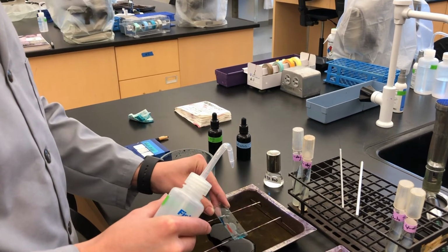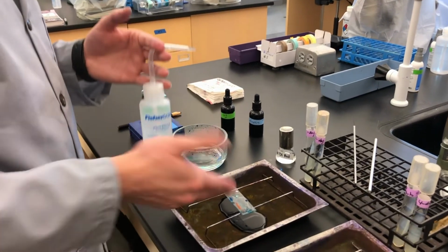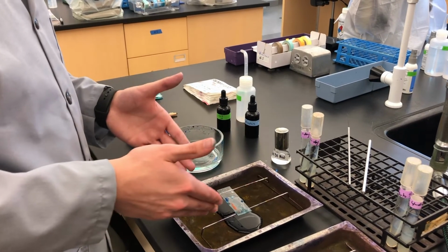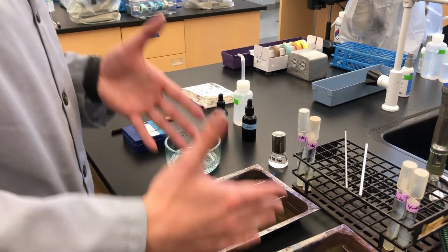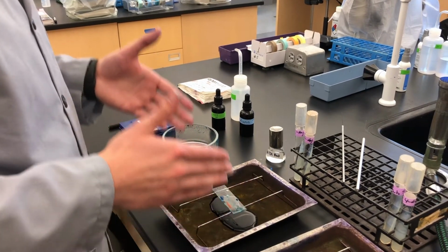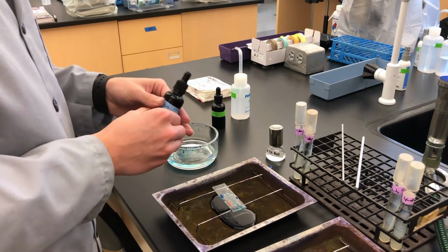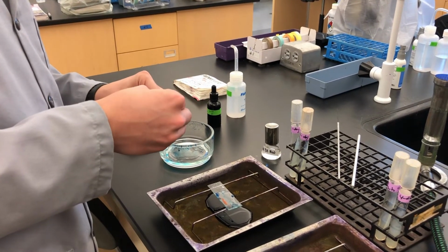Okay. Now, as long as an endospore is formed, that malachite green that we microwaved into the endospore has remained here. All other malachite green should have washed off of the bacteria. If that's the case, then when we come in to counterstain with safranin, all of those cells should pick up the red dye.